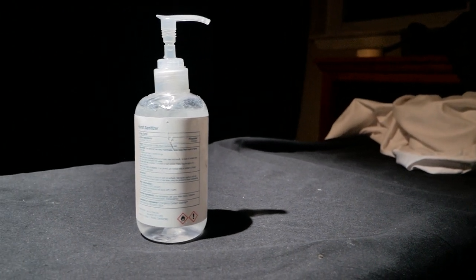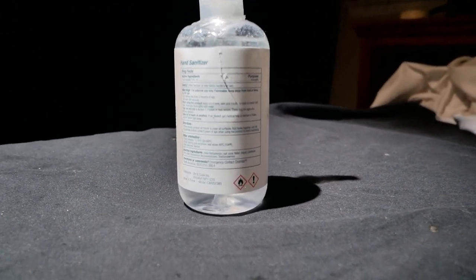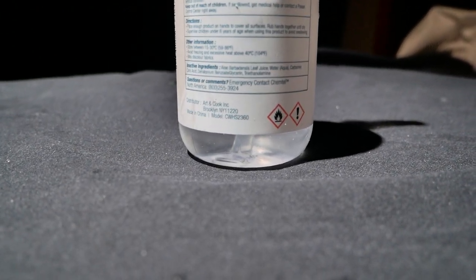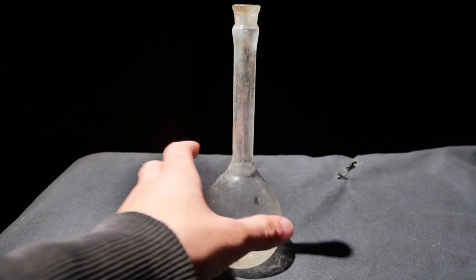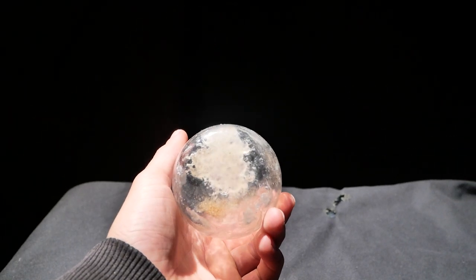So in today's video I'm going to be distilling this stuff and I'm mainly doing this to get rid of the glycerin which makes it so viscous. Now most of my videos are impromptu but you can tell from the bottom of this flask that this one took a while to get right.